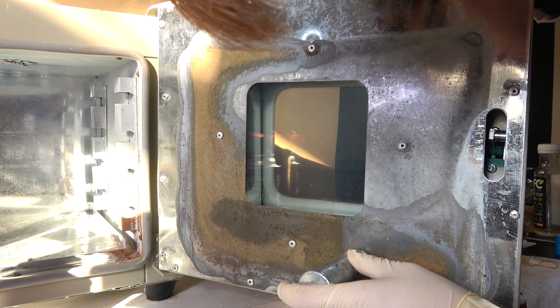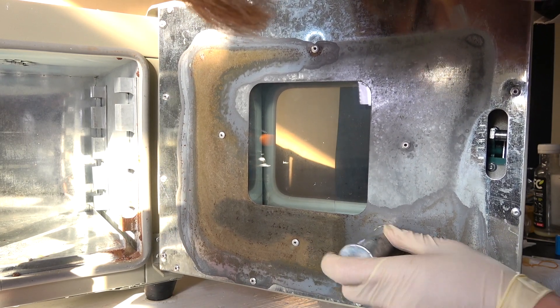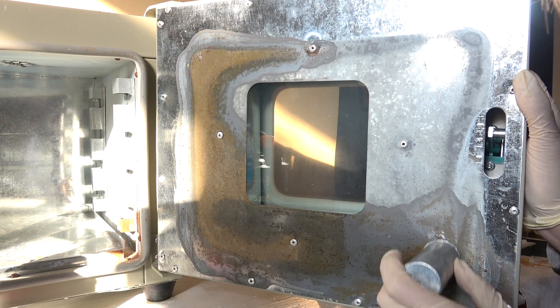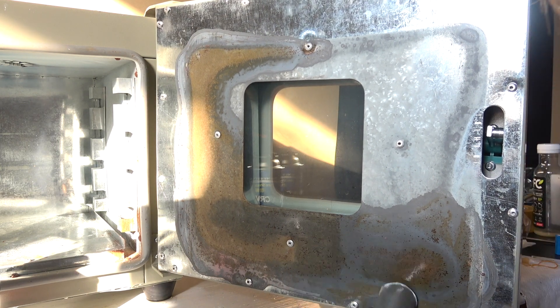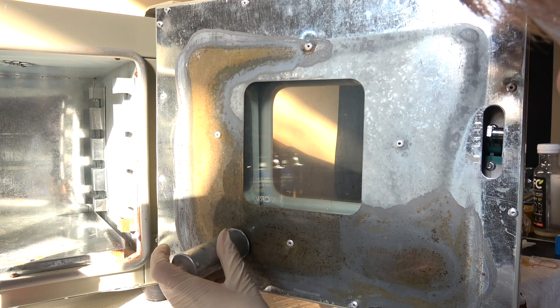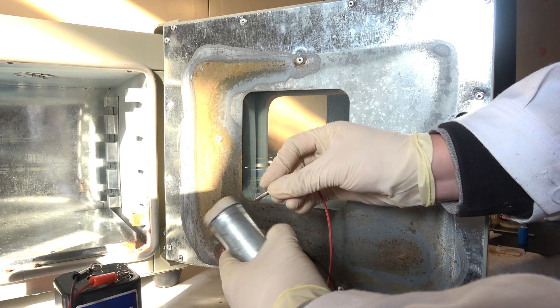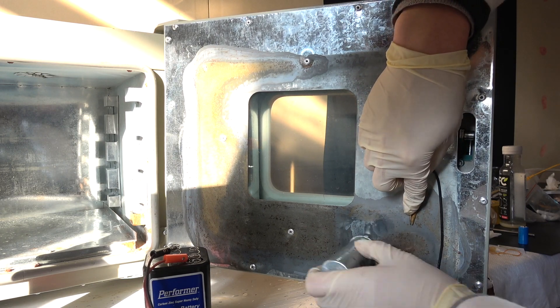What's happening here is pretty straightforward. The zinc cylinder acts as an anode — metallic zinc is oxidized to Zn²⁺ ions, and the two electrons travel through the conductive zinc case and are received by the Zn²⁺ ions from the electrolyte. This reduces them back to metallic zinc, which is deposited on the iron. Essentially we are transferring zinc from the cylinder onto the panel using the power generated by the cell itself, though the rate is unbearably slow. I opted to use an external power supply to boost the rate of zinc plating by hooking up the positive terminal to the cylinder and the negative terminal to the panel. With the additional power, the effect is much clearer.